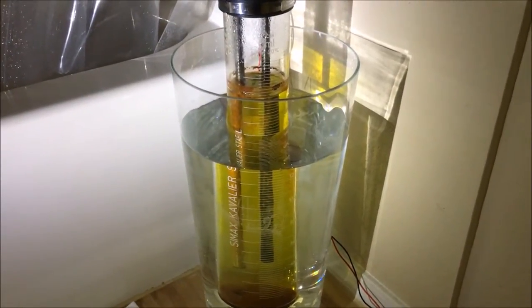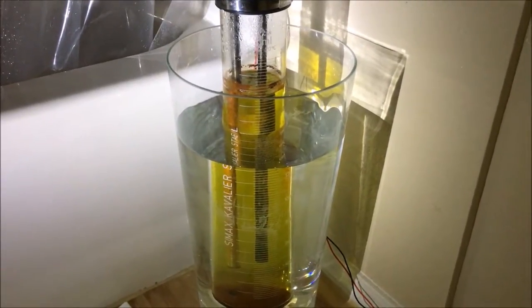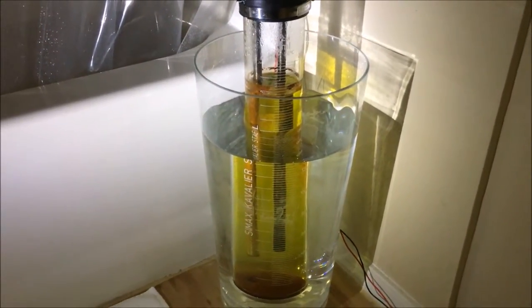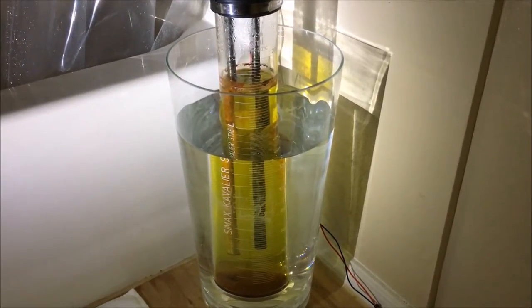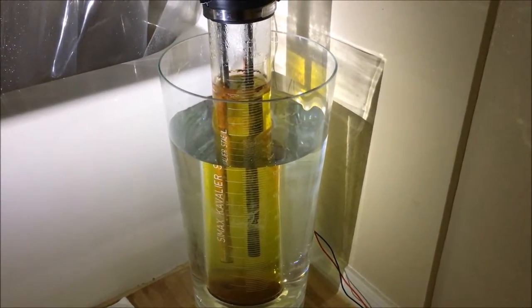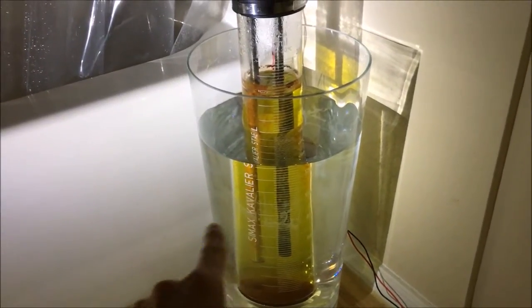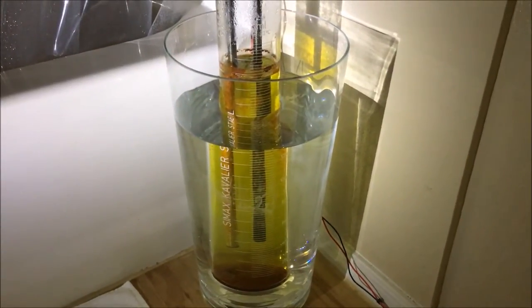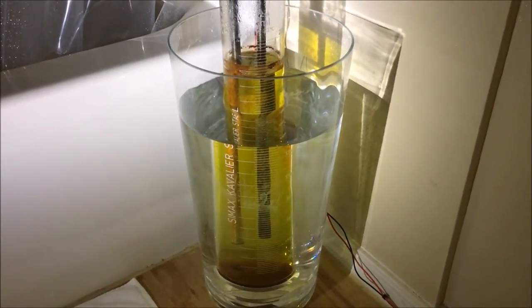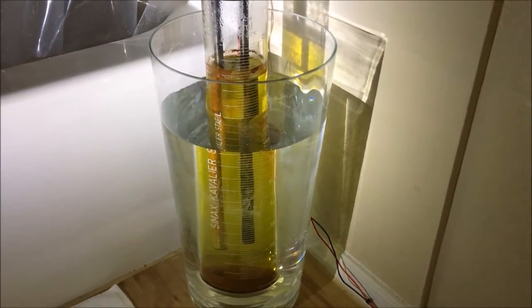on the stainless steel. After doing some research, I've determined that to make a viable steel or stainless steel electrode electrolysis system in sodium hydroxide, you have to keep the overpotential extremely low. Since the electric potential of a hydrogen oxygen cell is approximately 1.23 volts, you should only be a few tenths of a volt over that in terms of the power supplied to it.